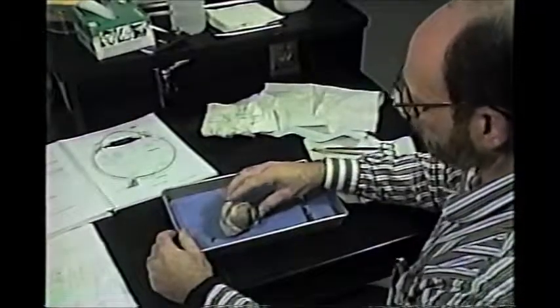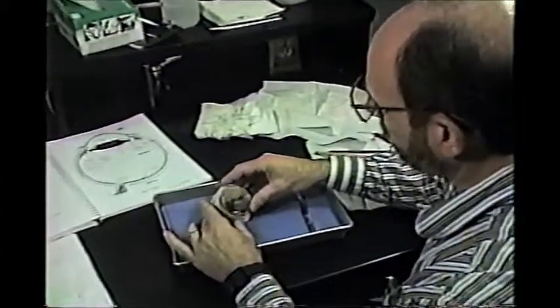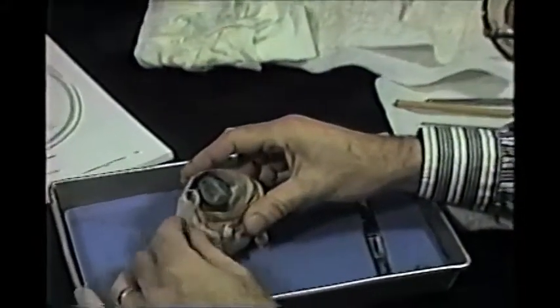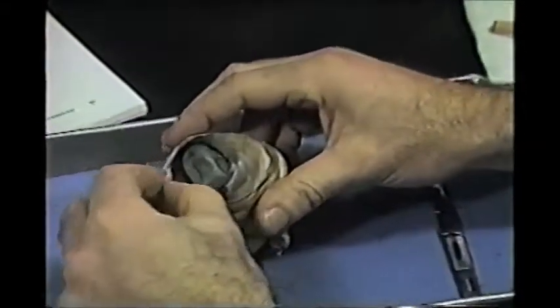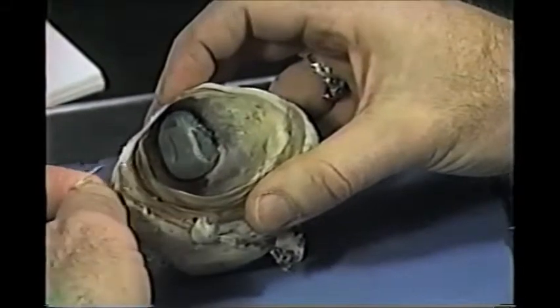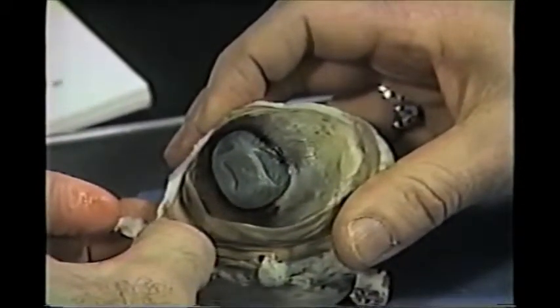Today we're going to do a demonstration dissection of a cow's eye. This is a preserved cow's eye, and some of the eyes you may see remnants of the eyelid. This part that I'm pulling down with my thumb here is probably the lower or upper eyelid — it's hard to tell.